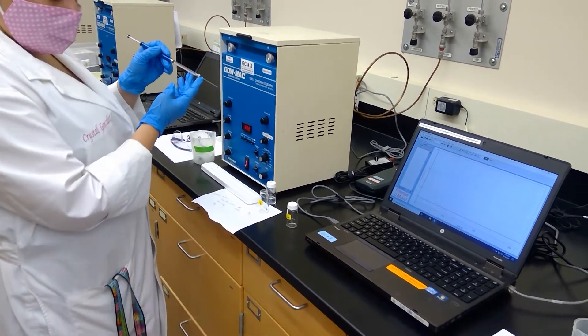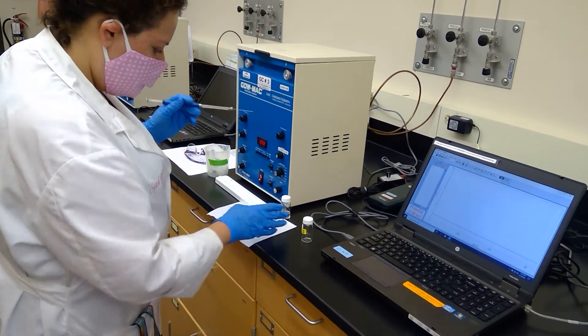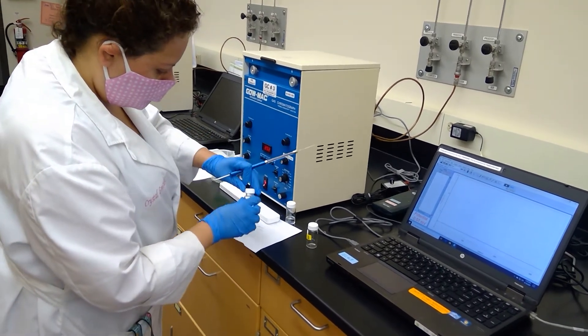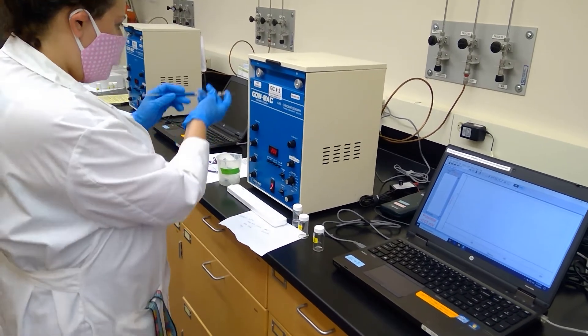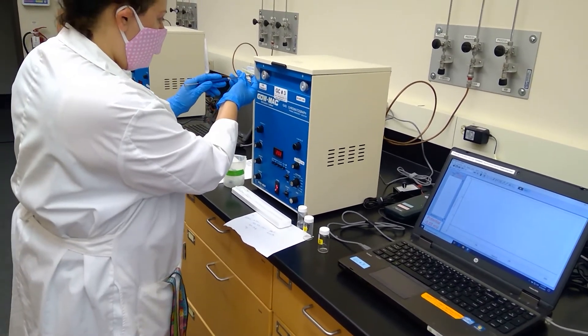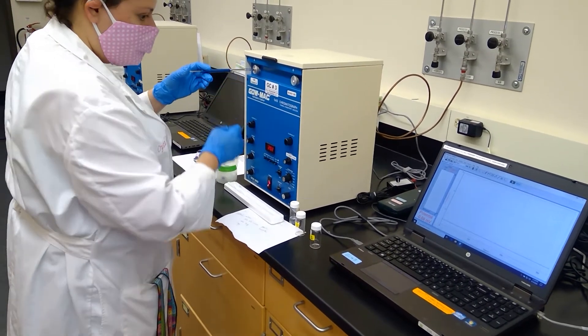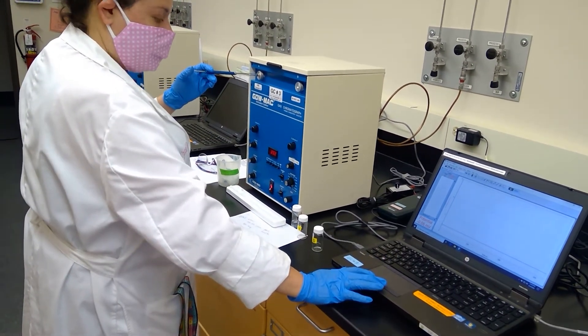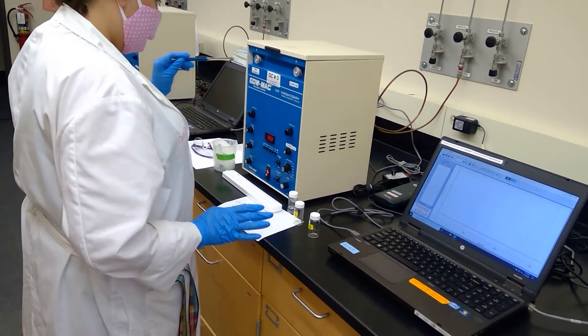Now that I have my needle ready to go, I'm going to ensure that my computer is ready to receive my information here. Let me be a good student here and close my vial. All right. So I'm going to go ahead and insert my needle into the port. I'm going to avoid touching that very hot metal end. And I'm going to push in my plunger and press collect at the same time.